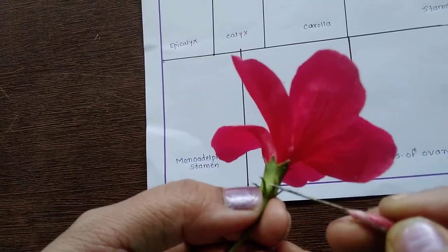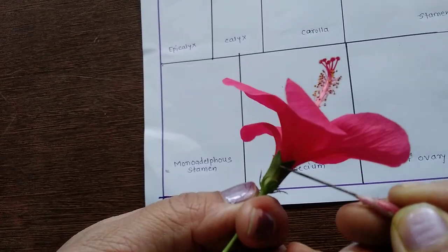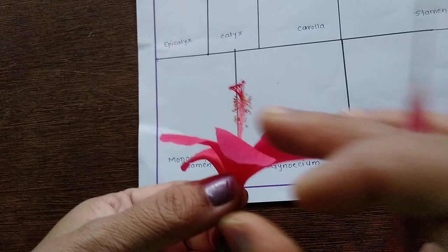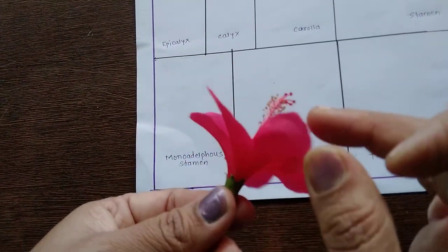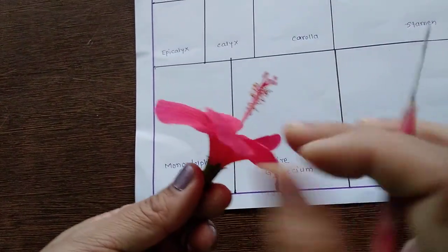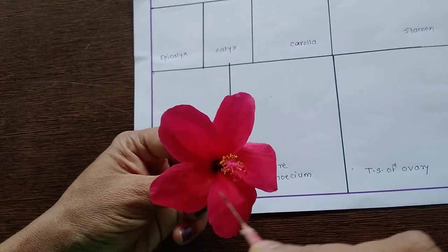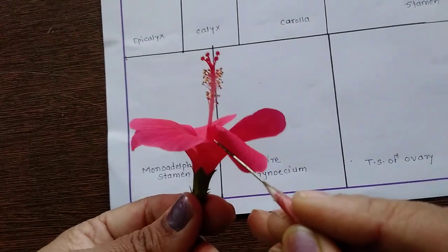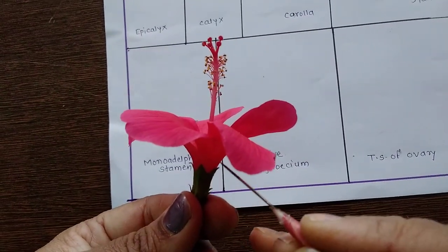This is the epicalyx. This complete whorl is the calyx. These are the bright colored petals. A single petal — the complete whorl of petals is called as corolla. Calyx and corolla are the non-essential parts of the flower.